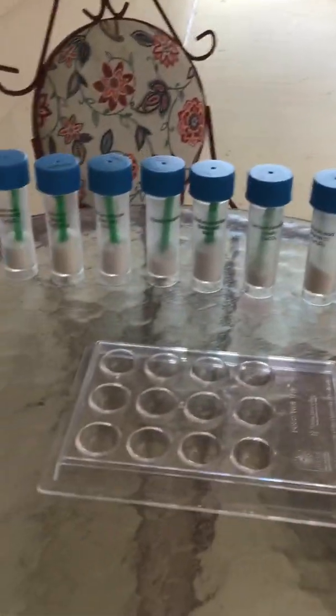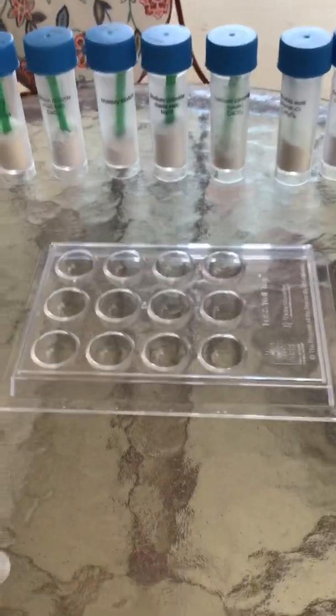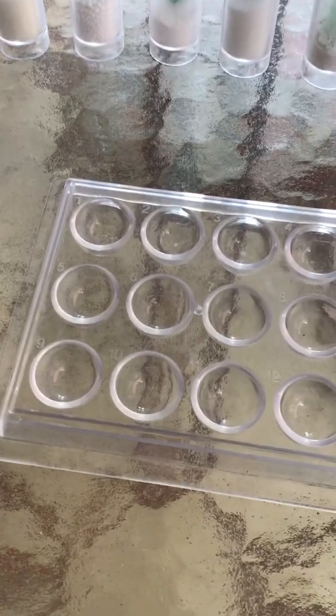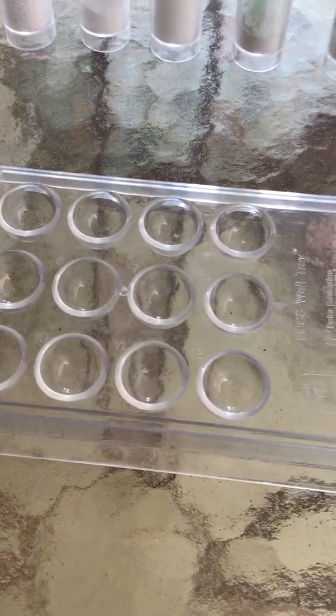You were supposed to learn about all these chemicals on the page before. This is the well I will be using to show you the different chemicals. For slide 16, all you have to do is write in the chemicals I mixed and what you noticed.